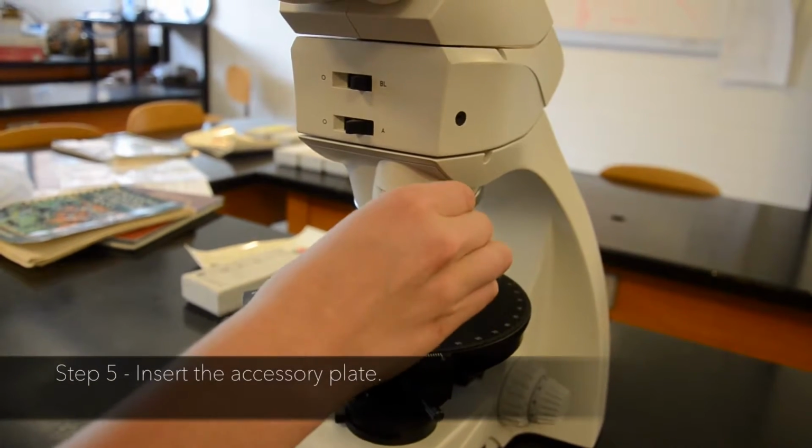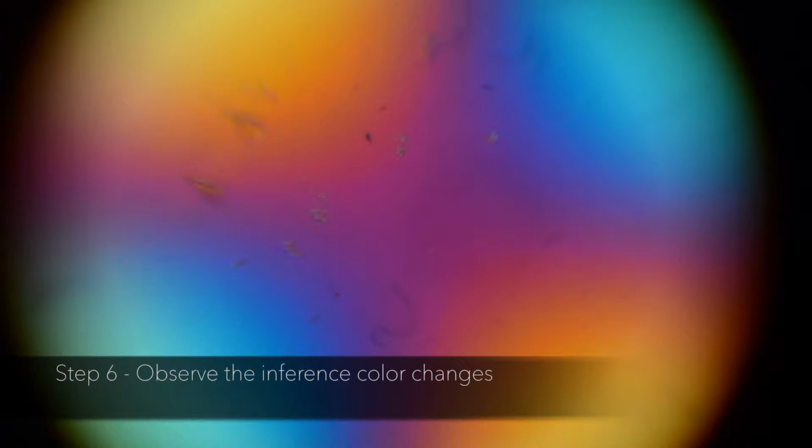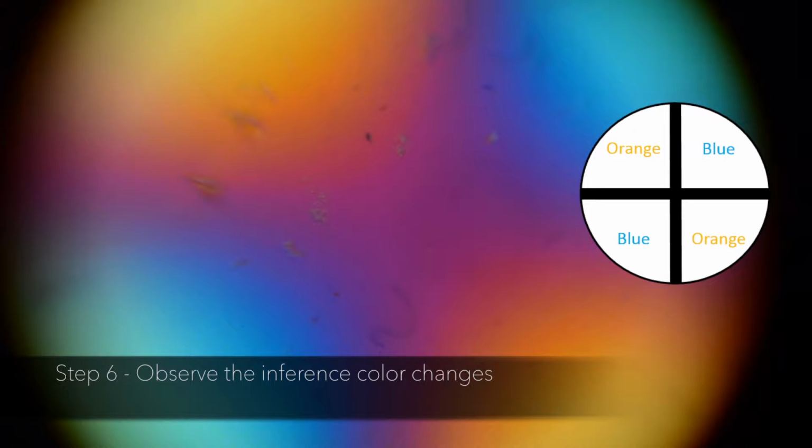Step 5. Insert the accessory plate. Step 6. Observe the interference color changes. Here, the northeast and southwest quadrants went from white to blue when we inserted the accessory plate, and the northwest and southeast quadrants went from white to orange. Also note that the interference color of the isogyres is now a first-order magenta with the addition of the accessory plate.